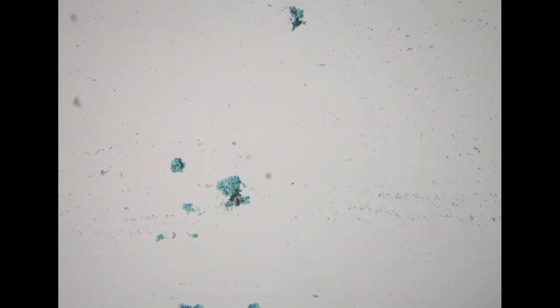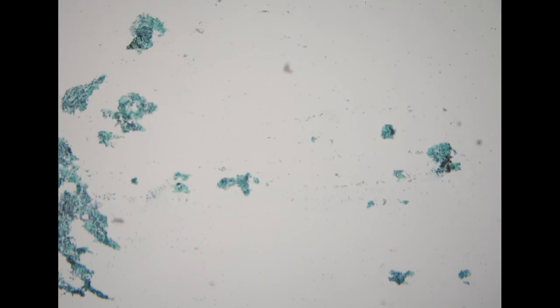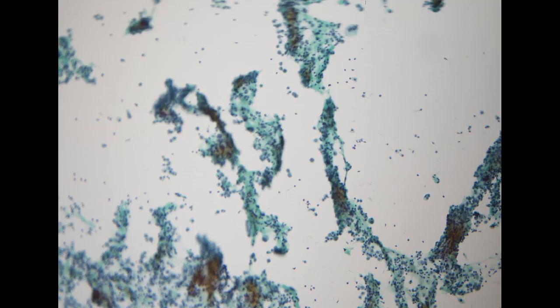So the next specimen is from a 72-year-old female. She had a past history of hepatocellular carcinoma. Hepatoma very, very rarely metastasizes to the peritoneal cavity. It only happens when it ruptures. But when it ruptures, the patient is in a very critical condition. At that stage, usually we won't receive any specimen because the patient has already been diagnosed.